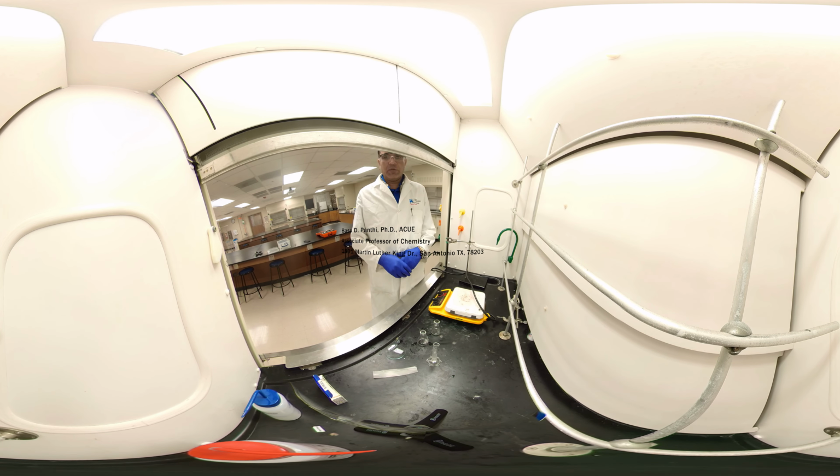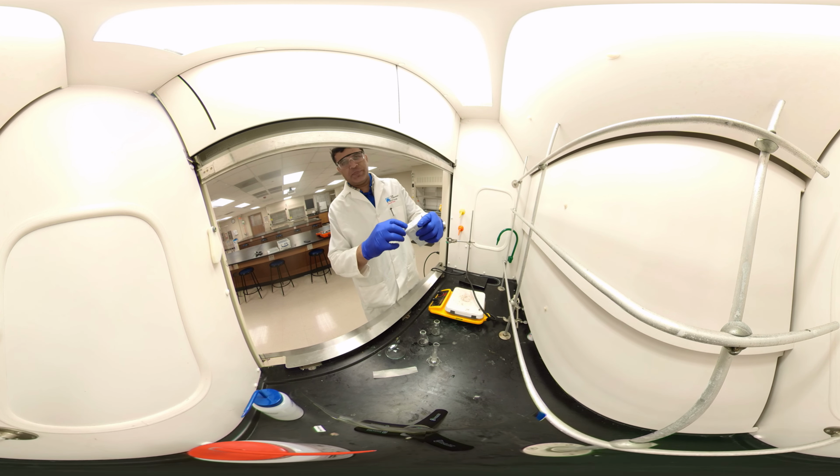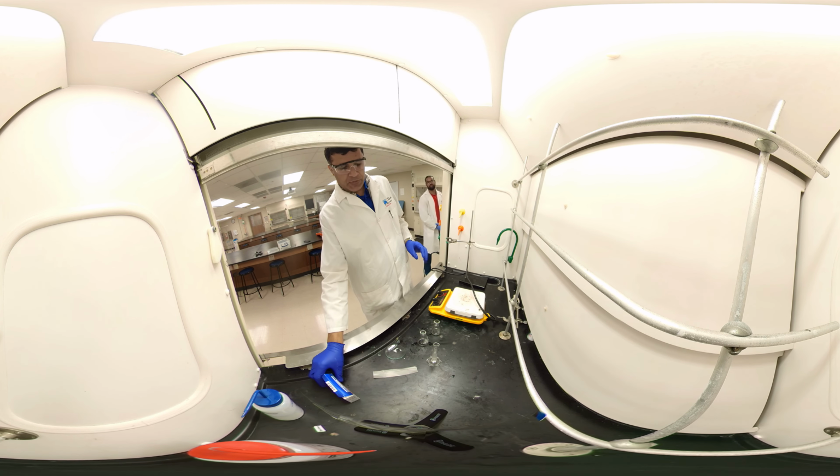I am going to talk about chemistry 21-23 lab. We are talking about acid-base extraction. In this experiment, I have Goody's powder. In Goody's powder, I have 4 components: aspirin, caffeine, acetaminophen, and binder. Our goal is to separate all 4 of them and compare how much we recover, based on the label.